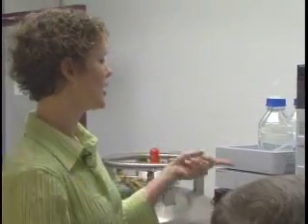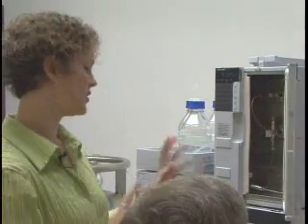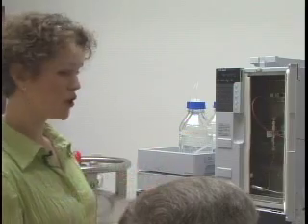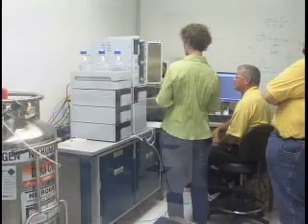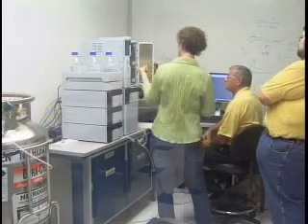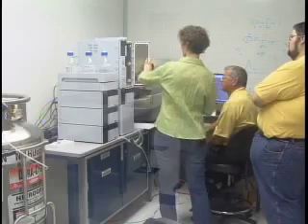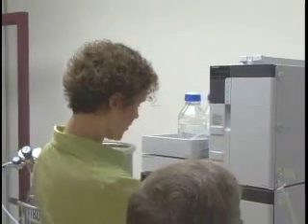This is the column oven. Inside we've got a filtering frit that we change every time before using the system — you want to use a new one because you don't want the system to get plugged up. The column in here is a standard reverse-phase C8 column that we use for our separations.